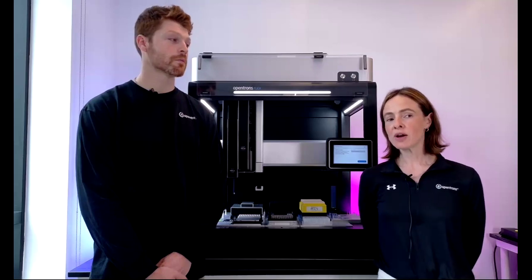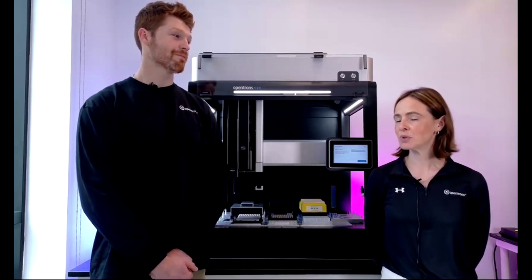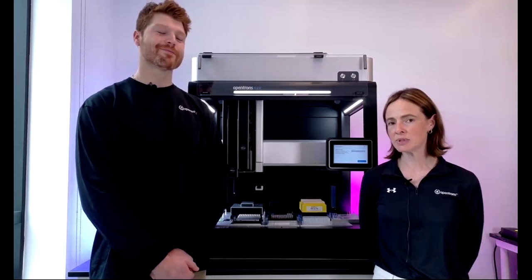Great. Okay, Josiah, regarding solvents and chemical compatibility with the pipette materials, are there any plans to develop a new line of pipettes that are more friendly to a wider range of solvents? It's not, I mean, we do get asked this quite a lot, actually. It's not on our current roadmap to do that. But keep asking, and keep asking for specific things, and then we can always look at what we might be able to add.